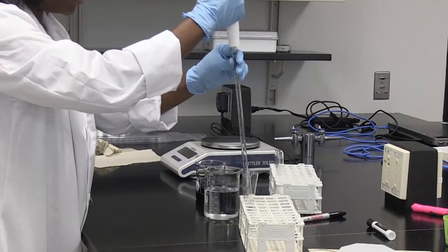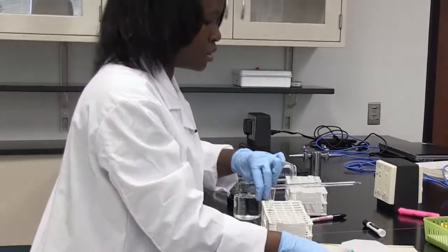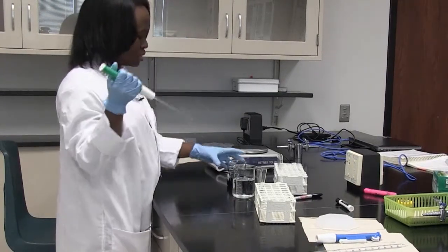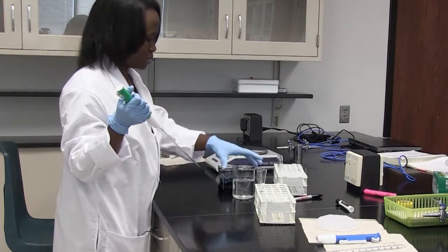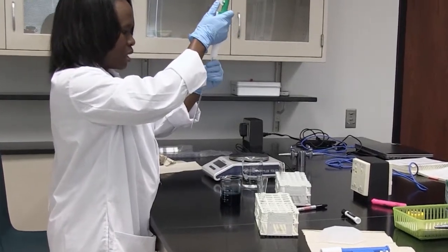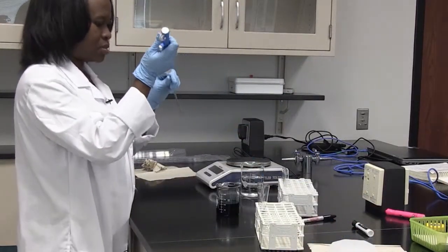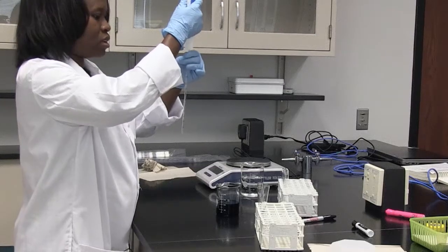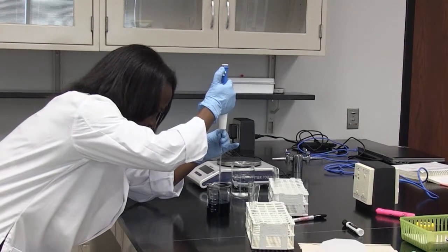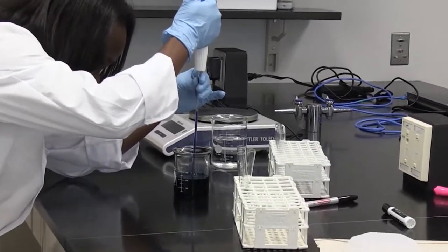We have now added the water to all three test tubes. Next, we need to add the varying volumes of our stock dye. This is our stock dye here. We're going to add 1 ml — using a different pipette pump specific to a 1 ml serological pipette — so we're going to add 1 ml of stock dye to the first test tube.